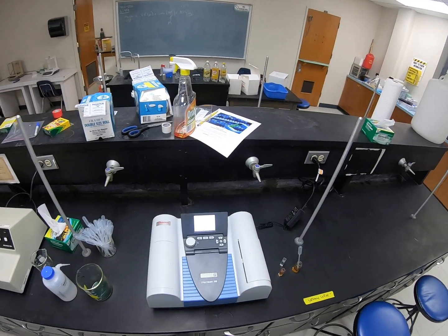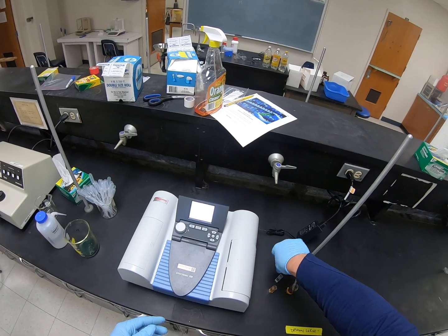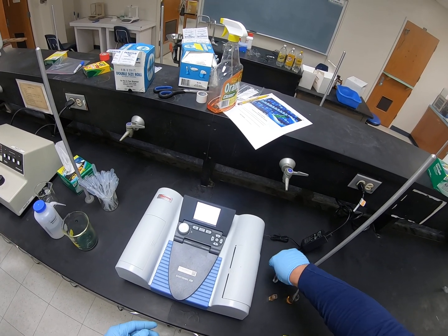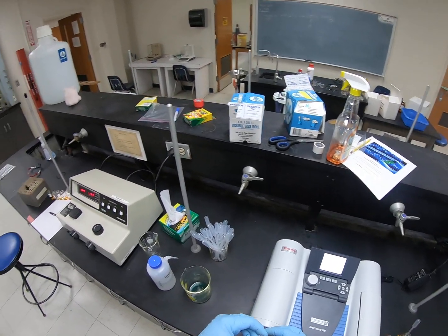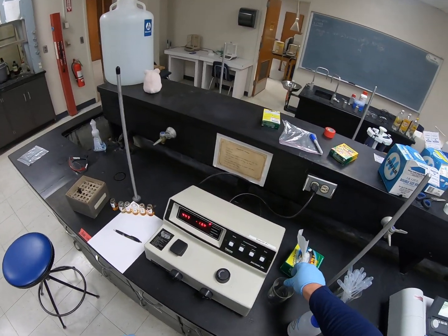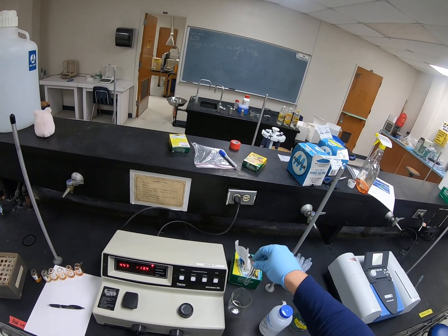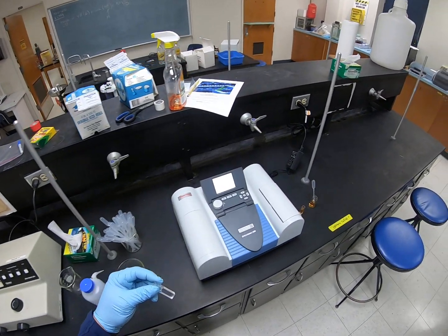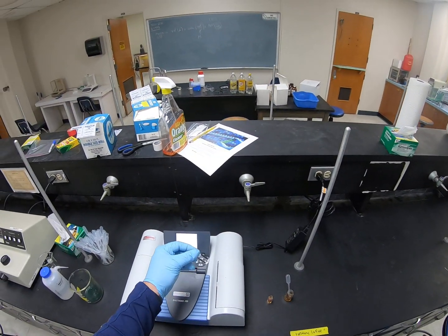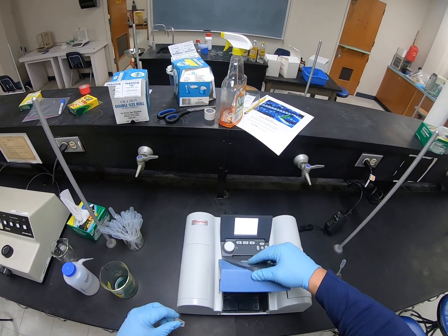This is a more modern version of this instrument, and this one is actually a scanning instrument, so it's capable of doing a spectra. So they use slightly different cuvettes. The Spectronic 20 uses this round cuvette. Looks just like a test tube, but the glass is a little bit more refined in its uniform thickness. And these use a square cuvette. Now these are plastic ones, so they're disposable.